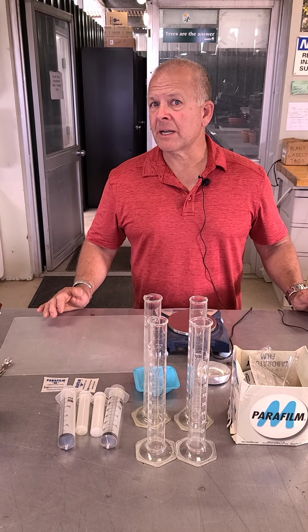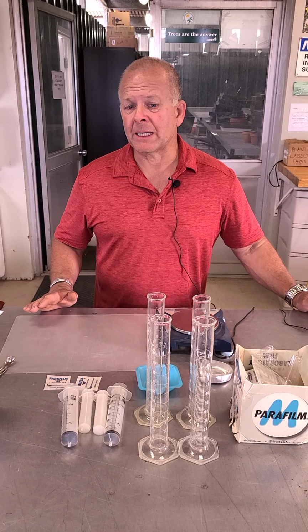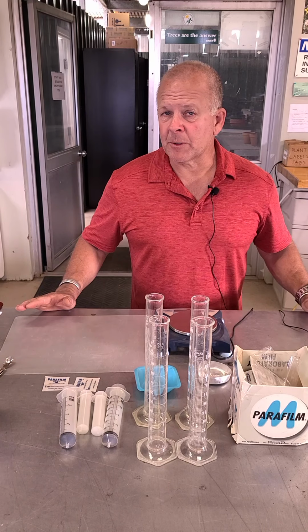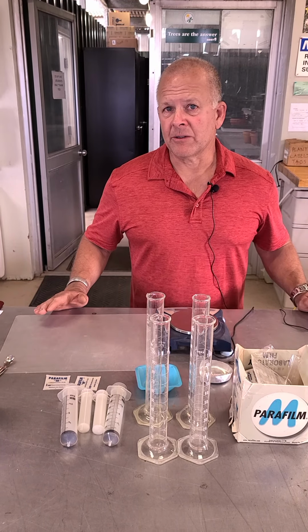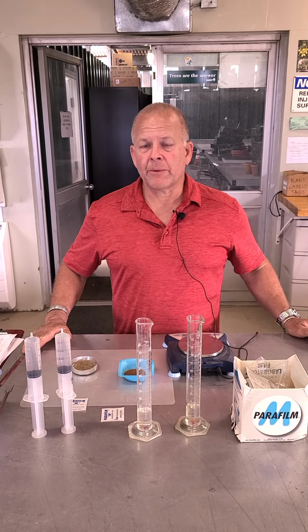It's not 100% accurate because there is going to be some air trapped. There's going to be some very small particles of air trapped in there that we're not even going to be able to see. We're going to try to eliminate that by tapping our sample and getting all the air bubbles that we can out. But for our purposes and for most purposes, if you wanted to know the particle density of your soil, this is how you could easily do it. All right?